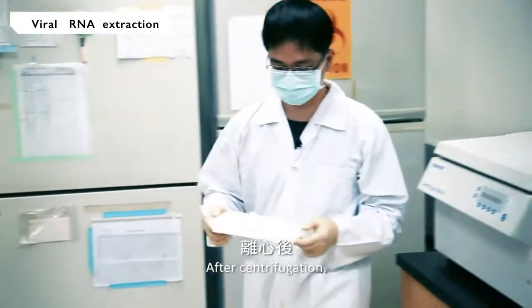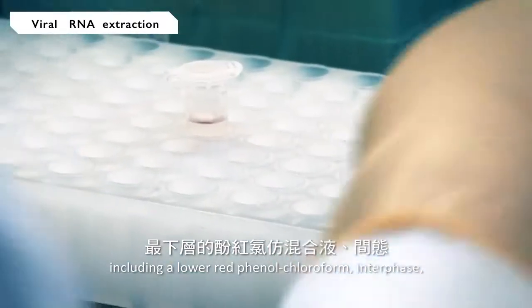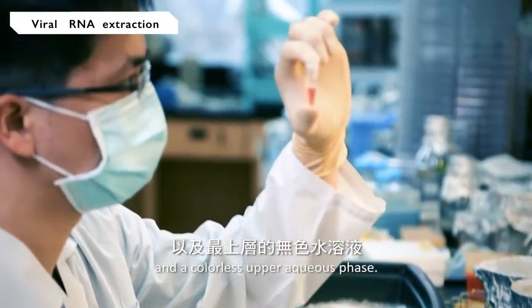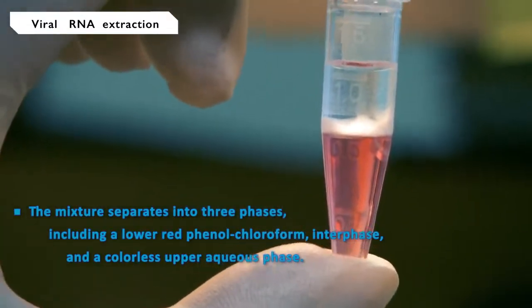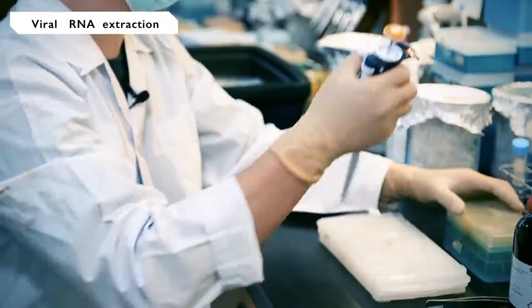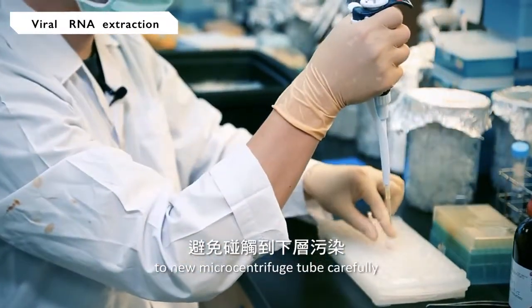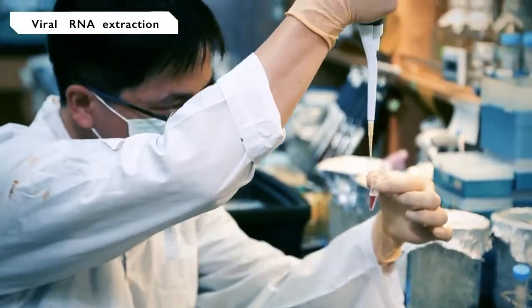After centrifugation, the mixture separates into three phases, including a lower red phenol-chloroform phase, an interphase, and a colorless upper aqueous phase. Extract and transfer the upper aqueous phase to a new microcentrifuge tube carefully. Avoid contamination with other phases.